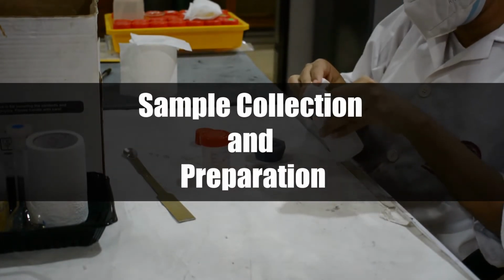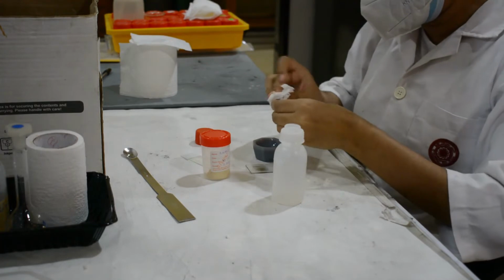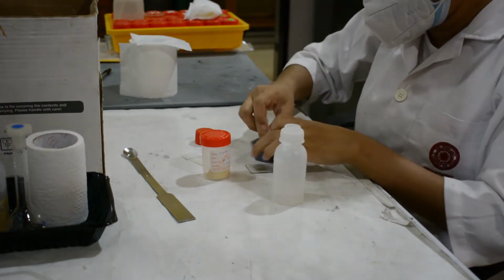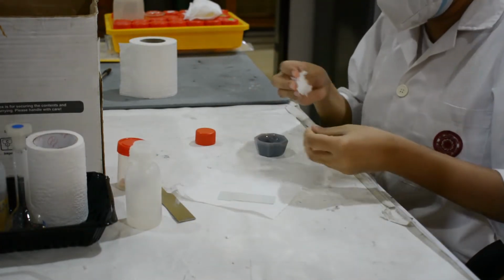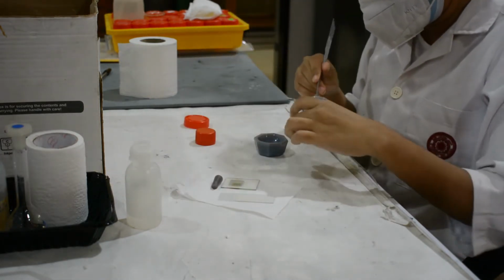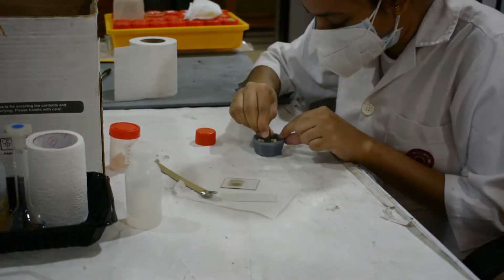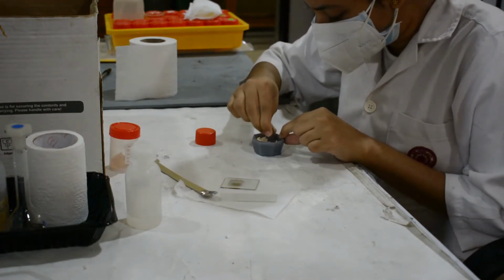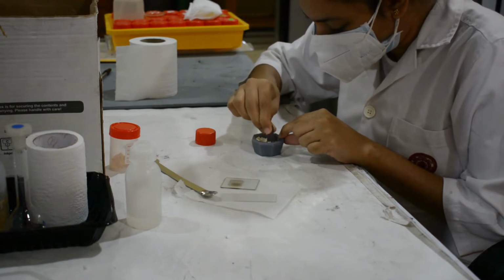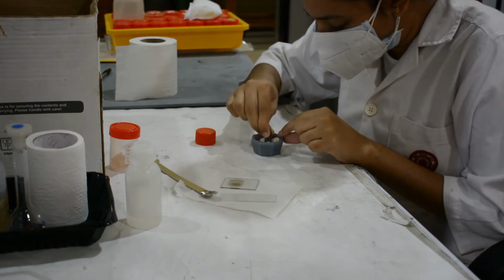Sample collection and preparation. Obtain a few tenths of a gram, or more, of the material, as pure as possible. Grind the sample to a fine powder, typically in a fluid, to minimize inducing extra strain that can offset peak positions, and to randomize orientation. Powder less than 10 micrometers in size is preferred.